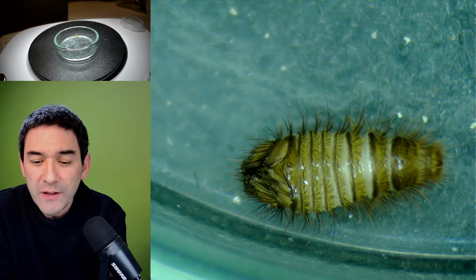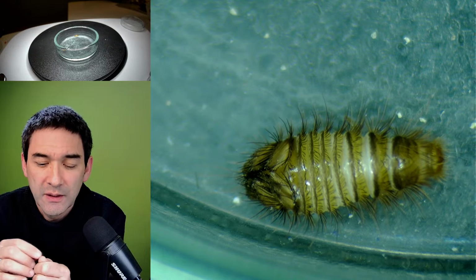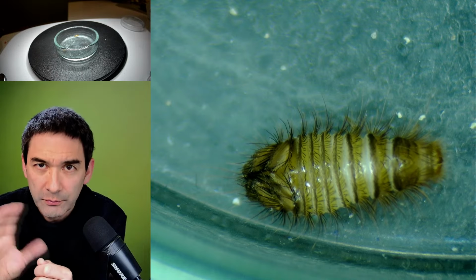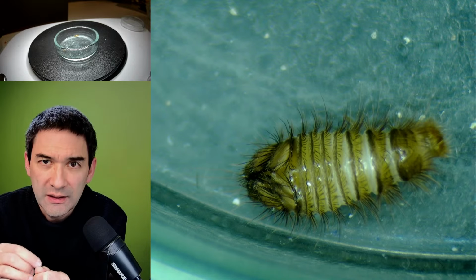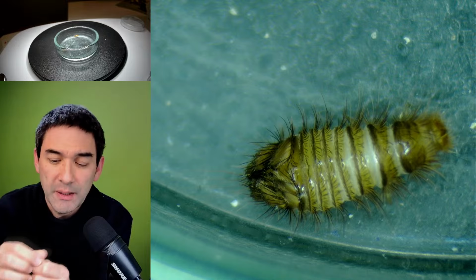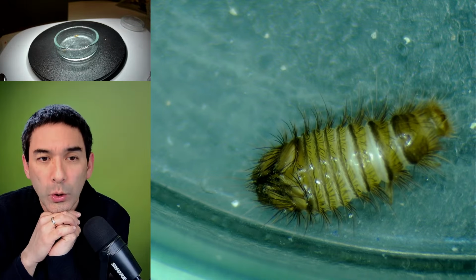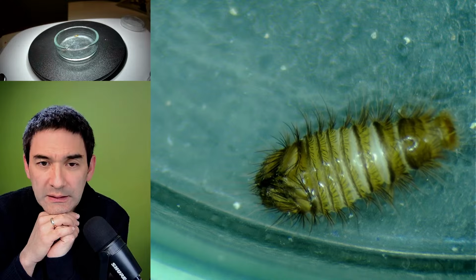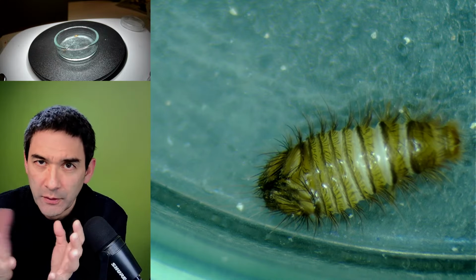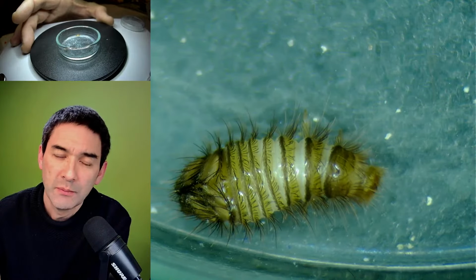I was feeding it some fingernails. I was scratching off some fingernails, which is a protein called keratin, not carotene from the carrot, keratin is written differently. That's the name of the protein of hair and of fingernails, and it eats that because this carpet beetle likes to eat wool. And wool, of course, is the fur of sheep. So that's basically what it eats.